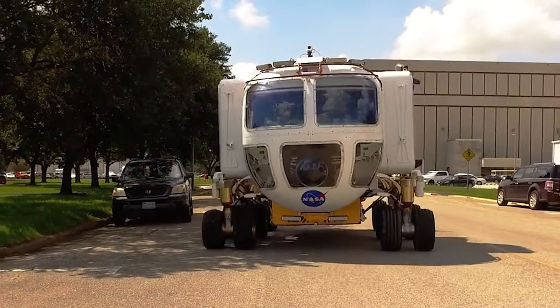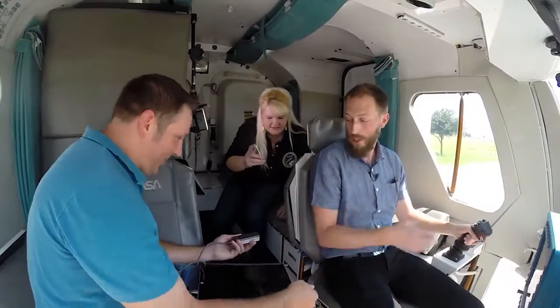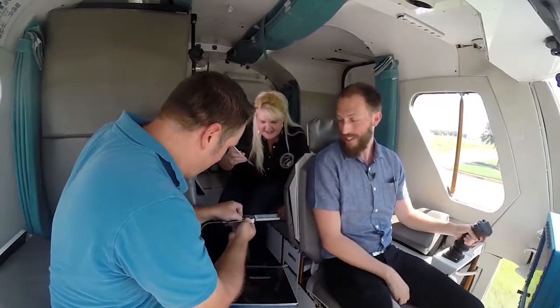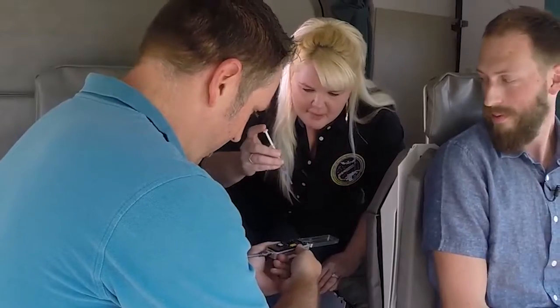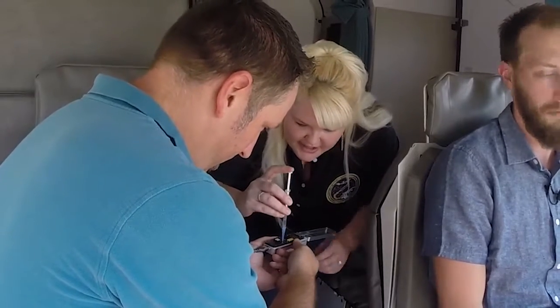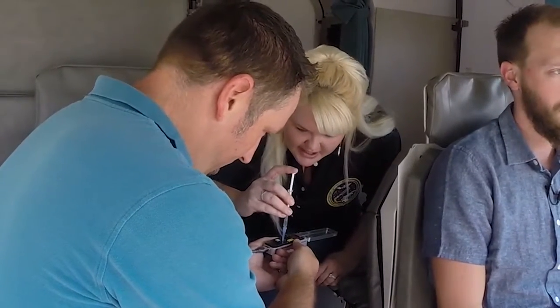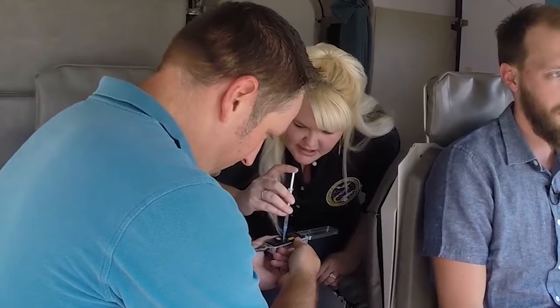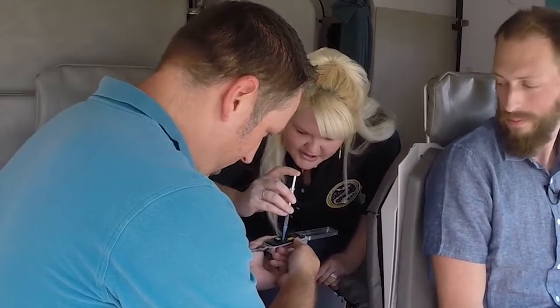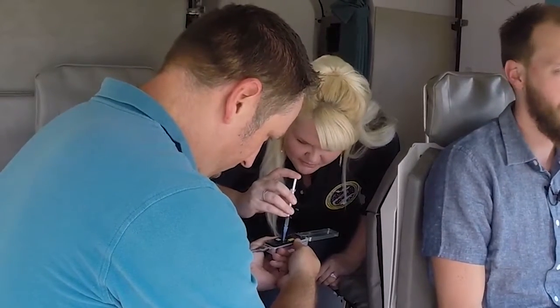Hey Aaron, you want to sequence some DNA in a rover? So you can do it right here, that's it. Yeah, this is it. That's small. That's insane. Okay, so what's actually happening? So I have a sample here that contains DNA from a mouse, a virus, and a bacteria. It's the same samples that are on the ISS that have been sequenced, and I'm injecting them into this miniature DNA sequencer, and we are actually going to start collecting the sequences while we're roving around.